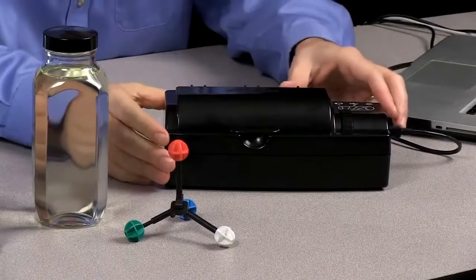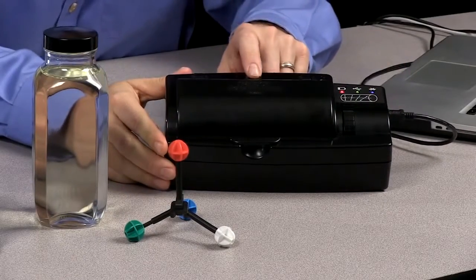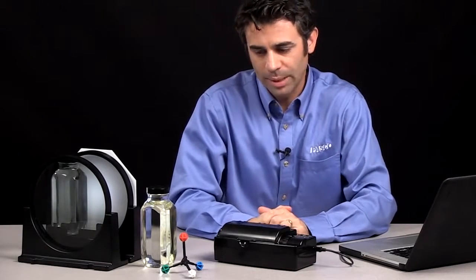Hi, I'm Tom Loschiavo, the Chemistry Education Manager at PASCO Scientific, and I'm here today to talk about the PASCO Polarimeter. So the polarimeter is a device used to measure the rotation of plane polarized light by optically active compounds.